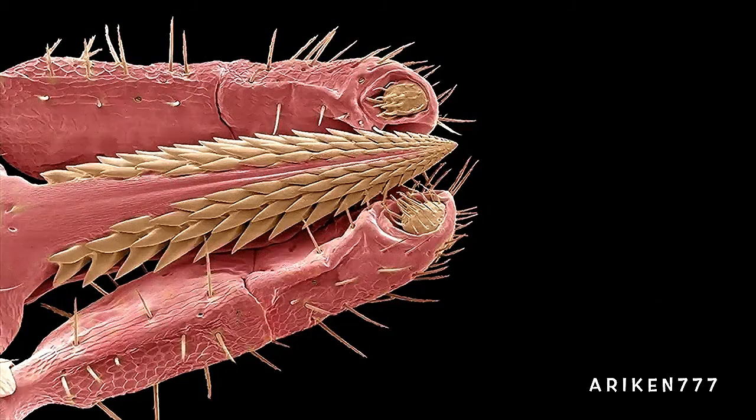This is the mouth parts of a tick, which consist of three visible components. The two outer jointed parts are highly mobile palps. Between the palps at the center is a rod-shaped structure called the hypostome. The palps do not enter the skin of the host while the tick is feeding, while the hypostome is inserted into the host's skin. The backward pointing projections prevent easy removal of the tick.